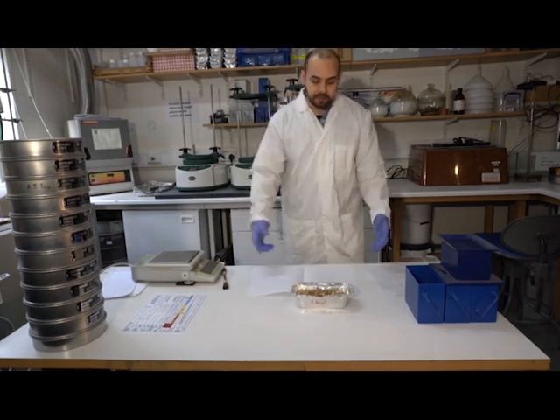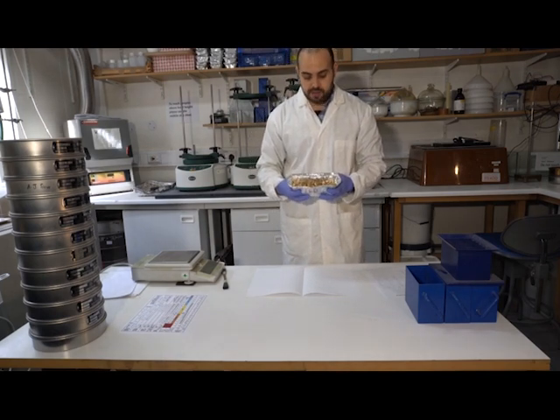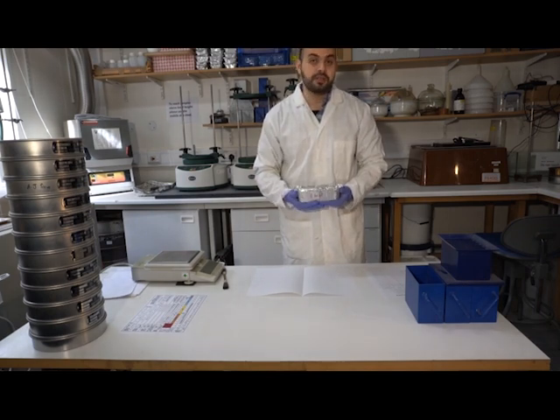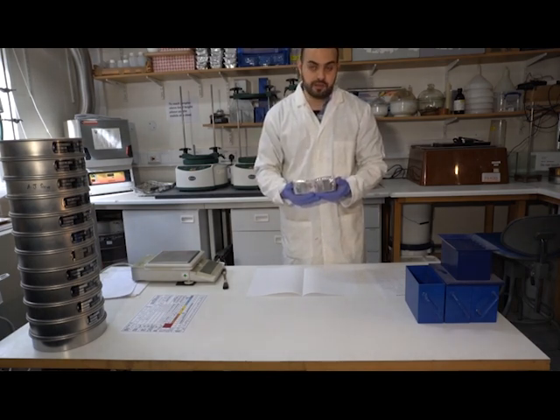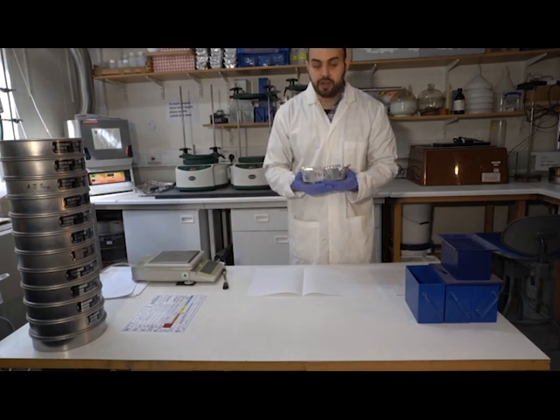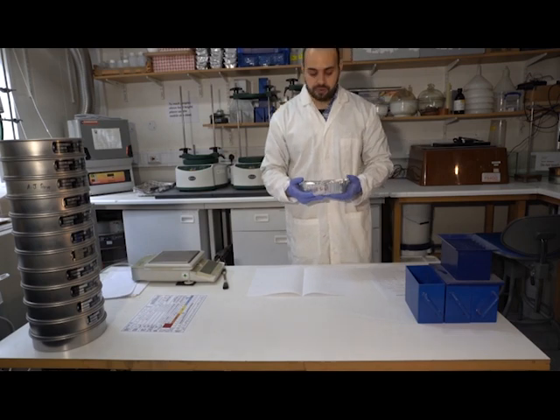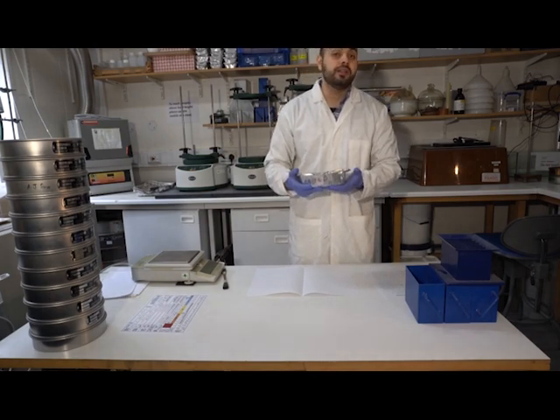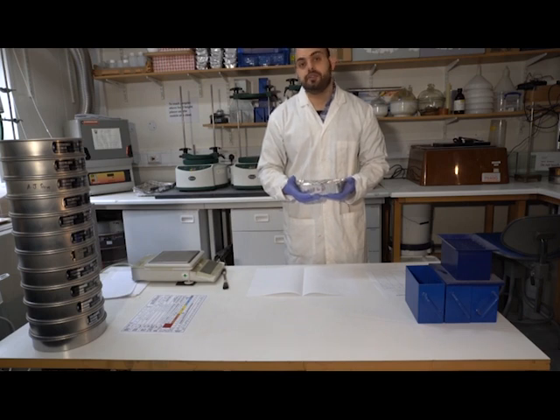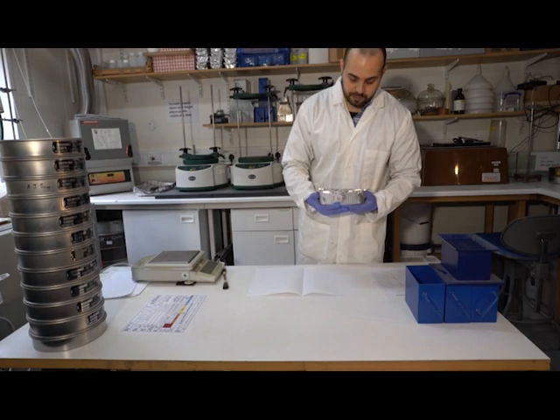So the sediment sample I have here today is from a coastal setting. This is sediment collected from Eastern Beach in the UK, on the southeast coast of England, along the Solent. And because it comes from a salty environment, the first step is to pre-process the sample. That simply means we need to wash it with clean or distilled water to remove all the salts, and then dry it in an oven overnight. Usually we dry it at 100 degrees Celsius for about 24 hours.